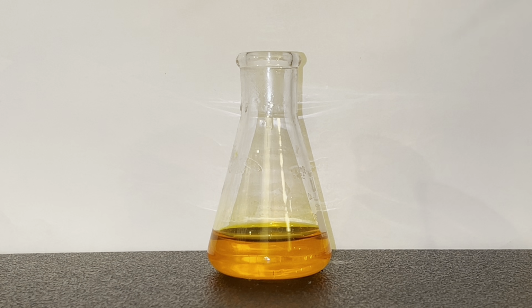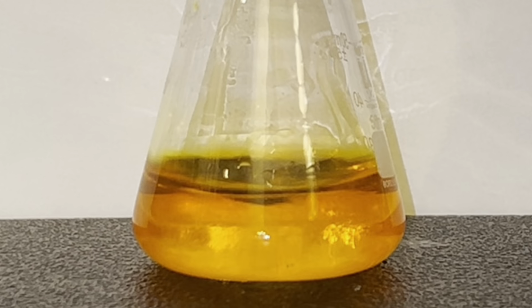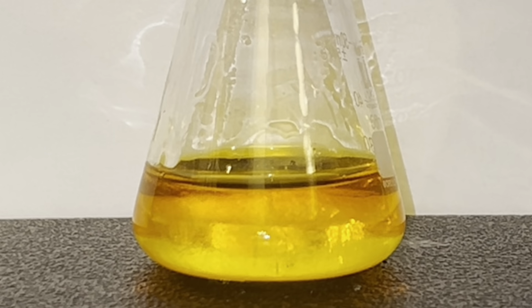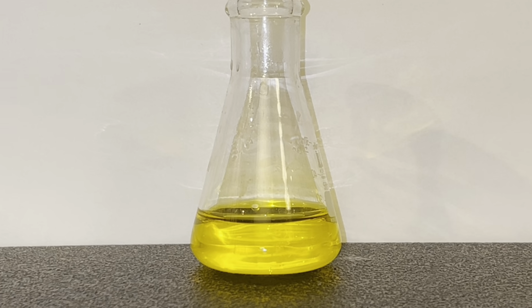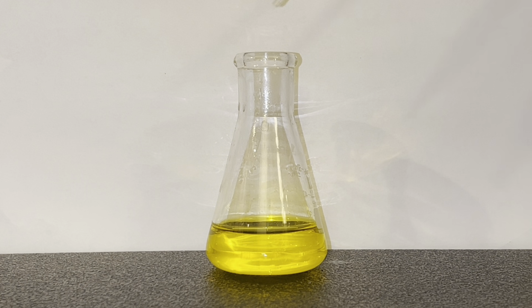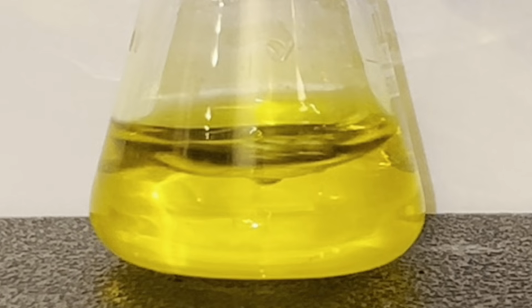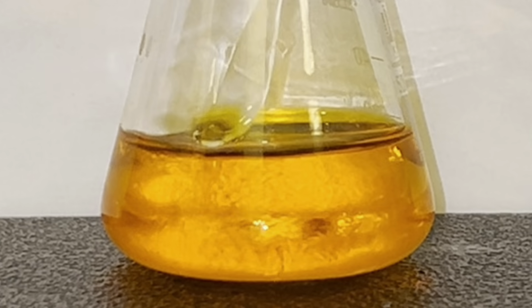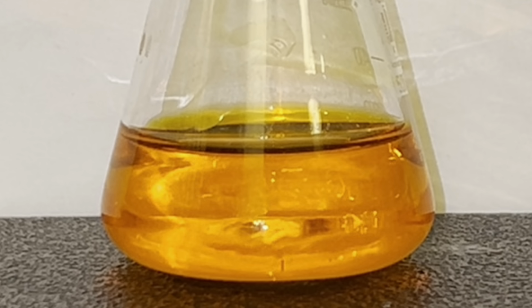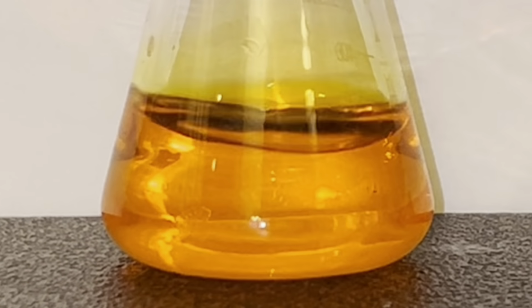Here I have a solution of potassium dichromate and water. When I add some sodium hydroxide, H+ ions are removed as the pH increases and the equilibrium shifts towards the formation of yellow chromate. When sulfuric acid is added, once all the hydroxide is neutralized, an excess of H+ shifts the equilibrium back towards the orange dichromate. You can see that the final sample is actually even darker than the initial solution, despite being more dilute, because the low pH favors almost exclusively dichromate.